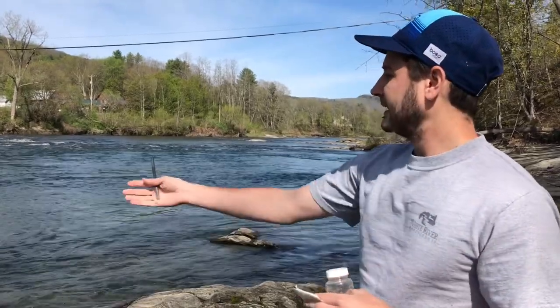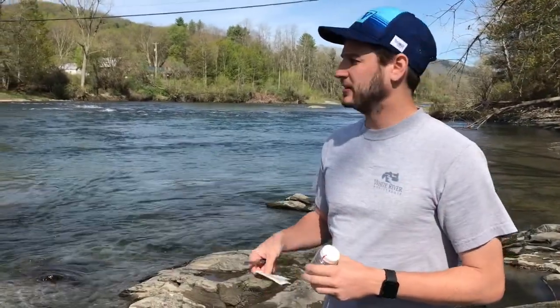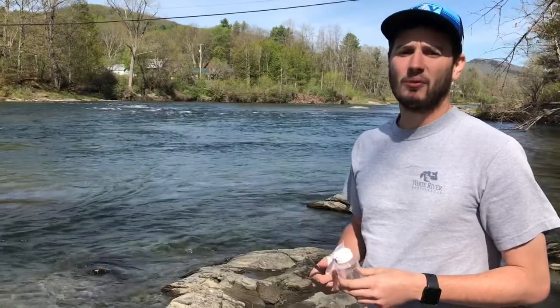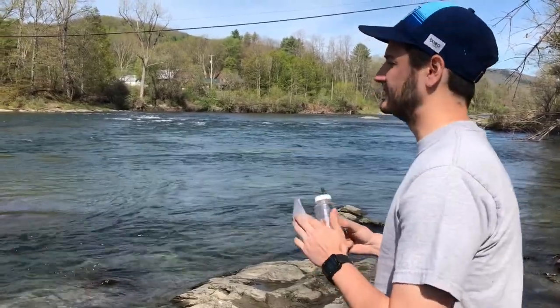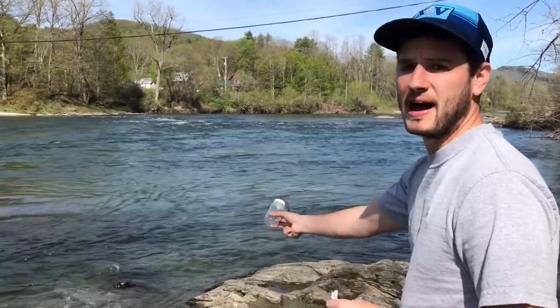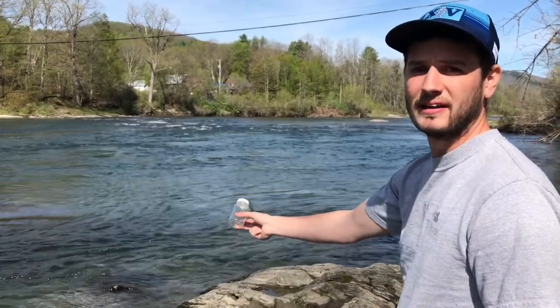I've identified a spot today where I can find some moving water. The last thing you want to remember when finding a spot is that you need to make sure you can position your body correctly. When you get in the water, you want to make sure your body is downstream from where you are sampling. You want to hold the bottle upstream of your body so the water does not run by your body while you're getting a sample.